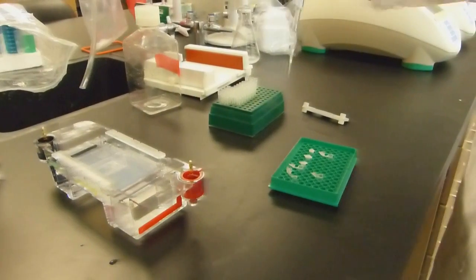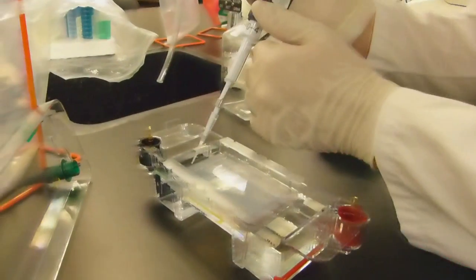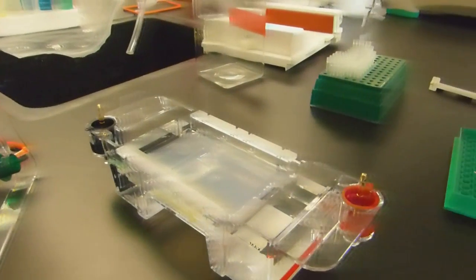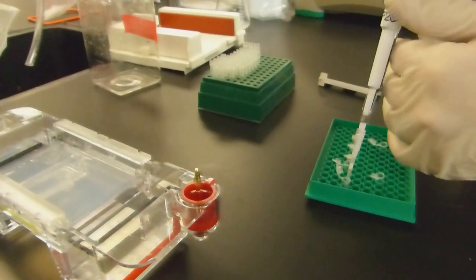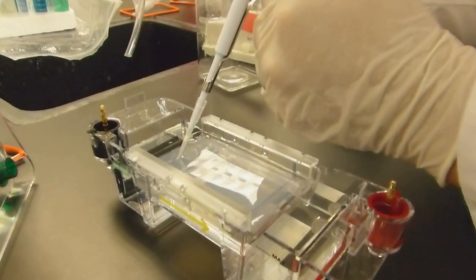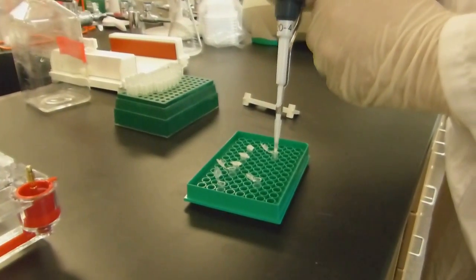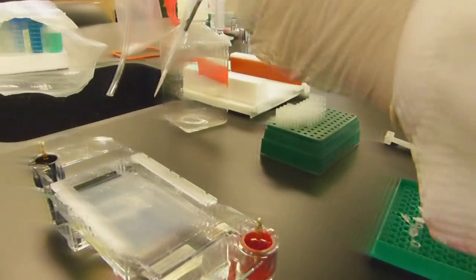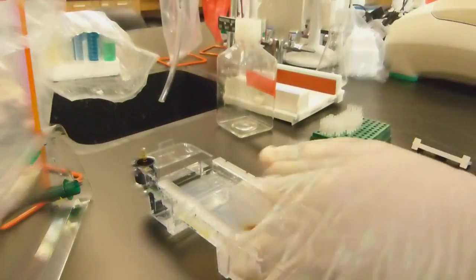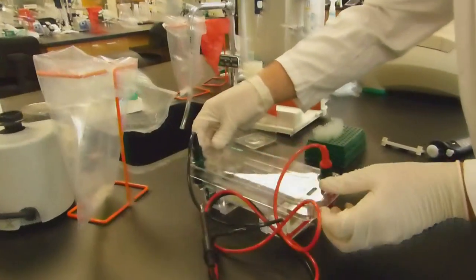It is time to load the wells. With a fresh tip, add 6 microliters of the GeneRuler 1 kilobase ladder to the first lane. Lanes 2 through 6 will be loaded with 20 microliters of your samples and the positive control. You choose those lane assignments. End by loading a duplicate 6 microliters of the GeneRuler to the final well. This will be the standard you use to measure the fragment size on your final gel, and having it on both sides of your samples makes reading the gel easier.